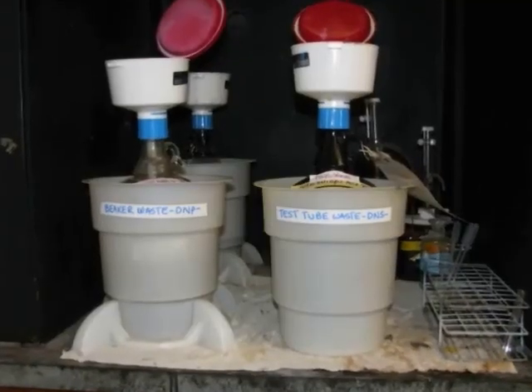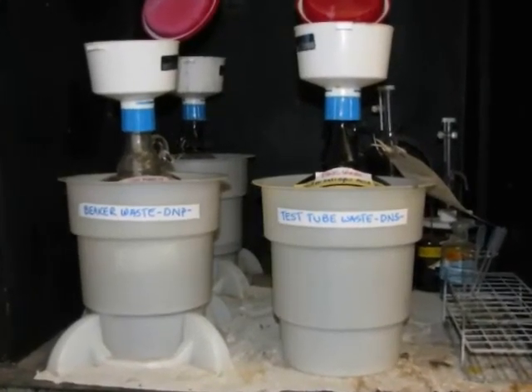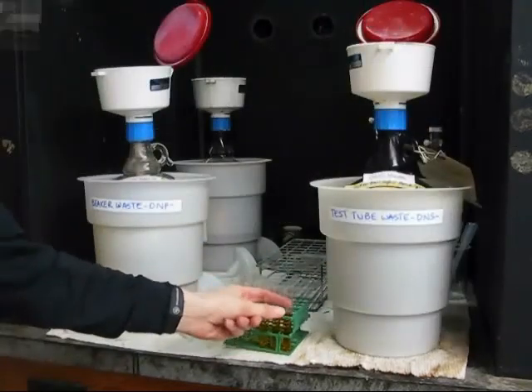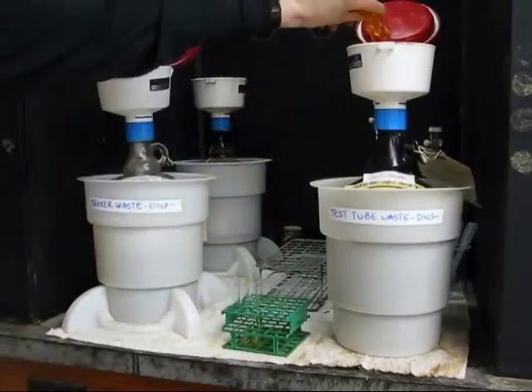Please dispose of all solutions containing either DNS or DNP in the appropriate waste container. Rinse all beakers and test tubes and leave them upside down to dry.